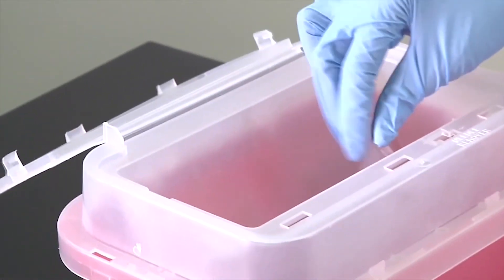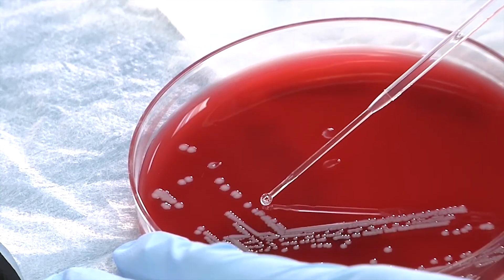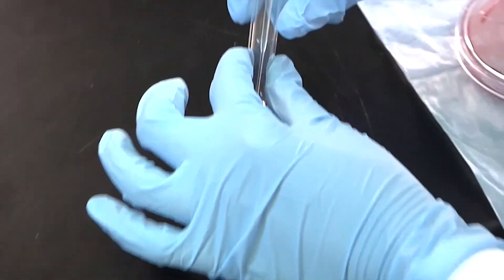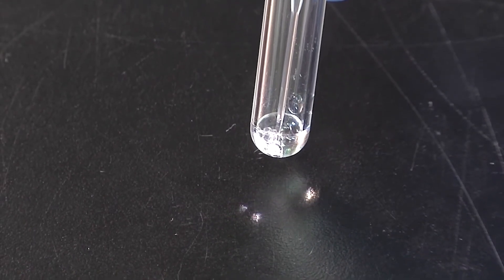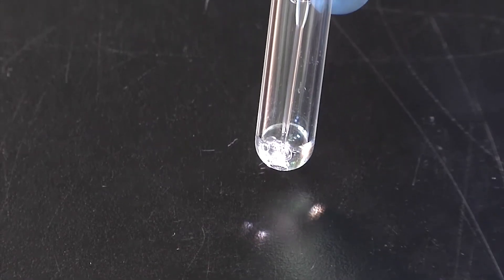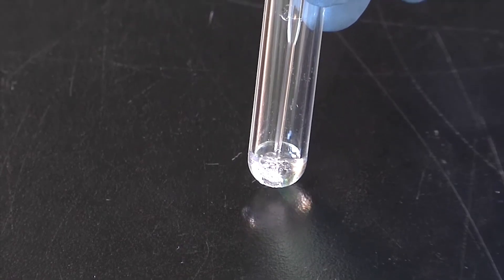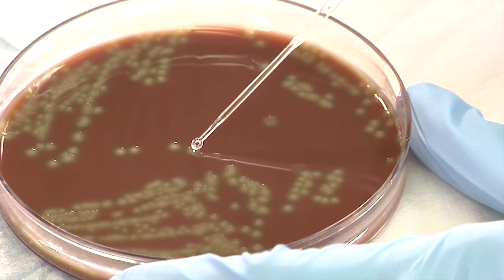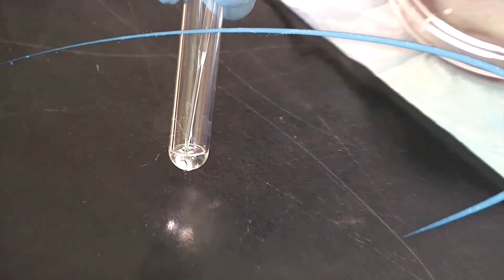Discard your pipette into a biohazardous waste container. Use the sterile applicator stick or plastic loop and pick up a small amount of an 18 to 24 hour old isolated colony from the positive control. Place and leave the applicator stick or plastic loop in the tube. Place the tube against the bench top or a dark background and look for the immediate formation of bubbles, which indicates a positive reaction. A weak positive has one to two bubbles. Repeat the process for the negative control. No formation of bubbles within 20 seconds indicates a negative reaction.